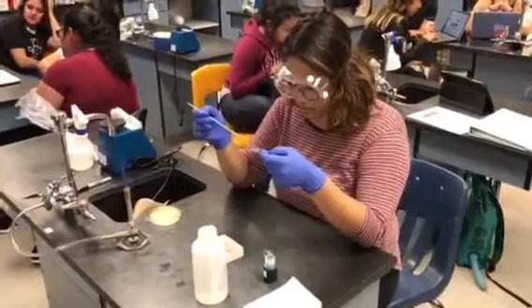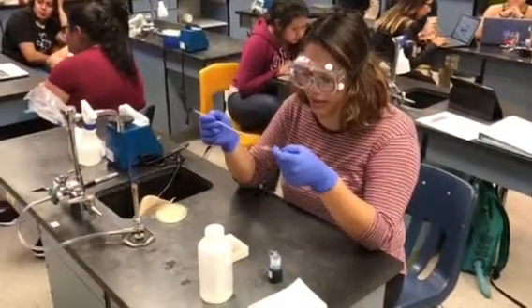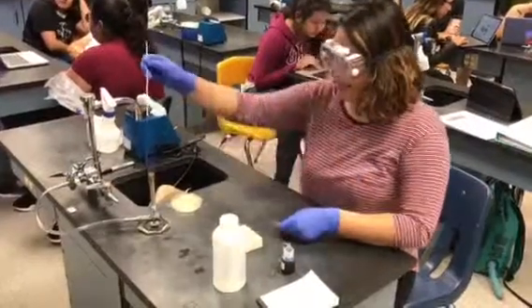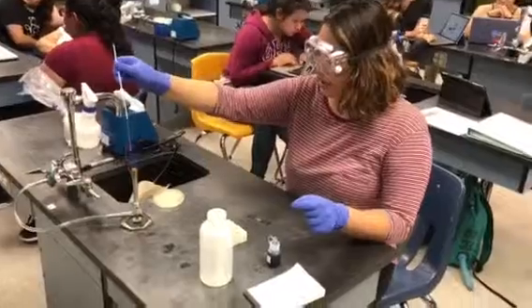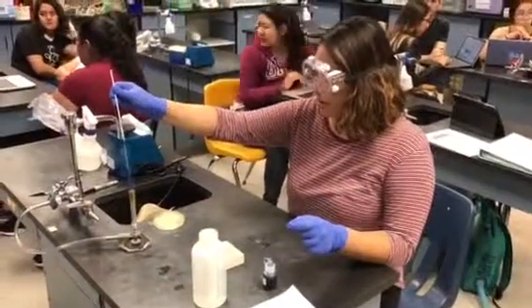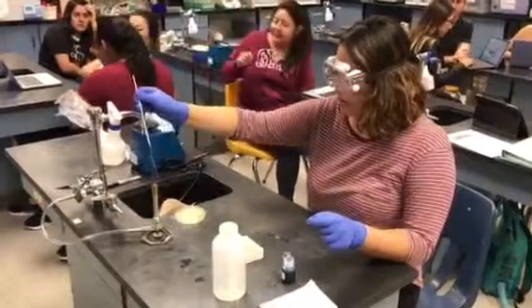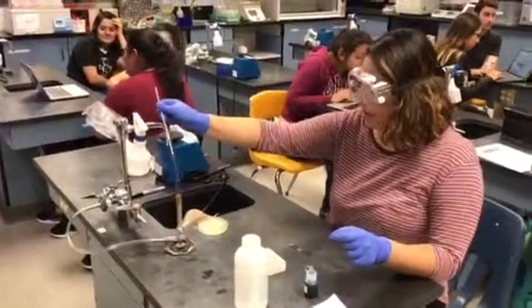Next, you're gonna wait for the slide to dry with the bacteria on it. That's why you want to have a small drop of water — because the bigger the drop, the longer it'll take to dry. Once you're done, make sure that you heat your loop again to sterilize it so you don't contaminate your bench and other people.